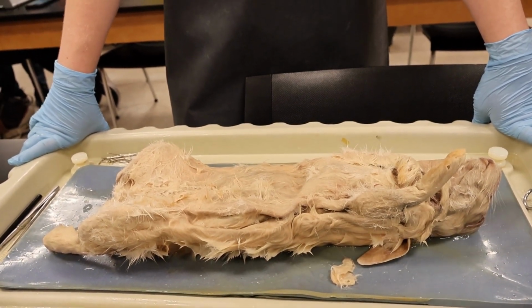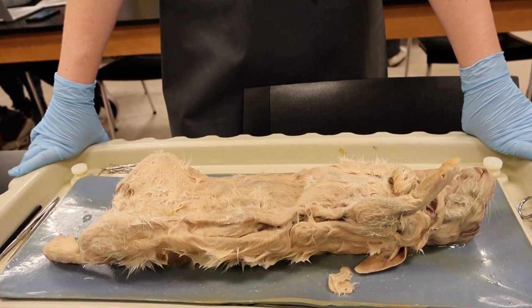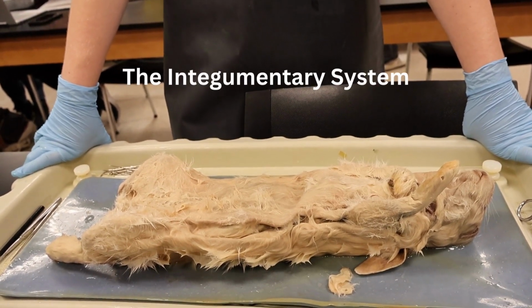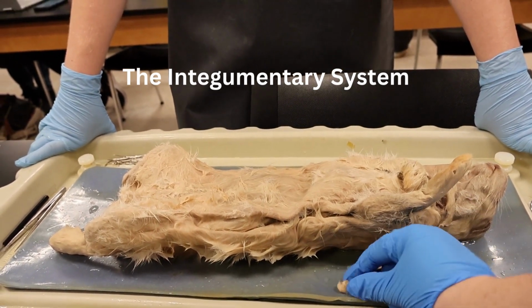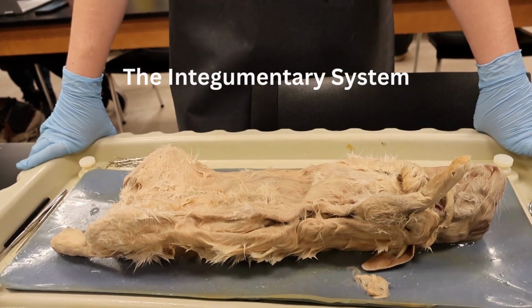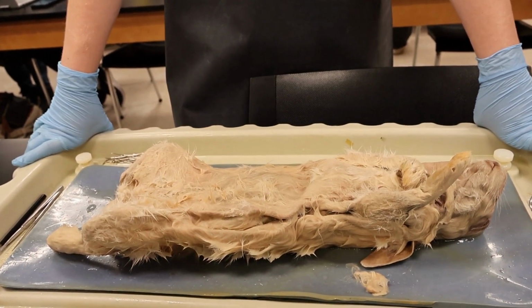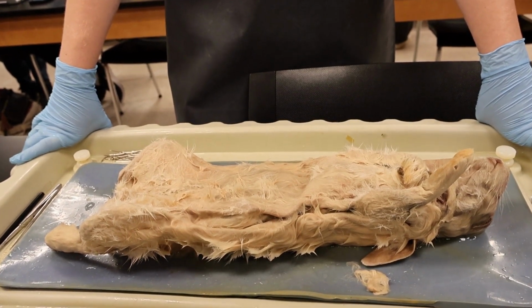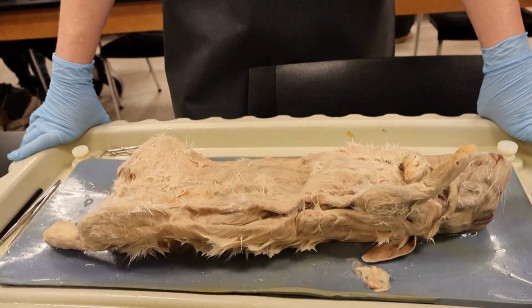The first system we're going to discuss and show on this recording is the integumentary system. First off is the hair of the rabbit. We did cut off some here, as shown. The hair of a rabbit is used for warmth and as an external barrier between the epidermis and the organs, as well as, in some species of rabbits, for camouflage, among other adaptations.